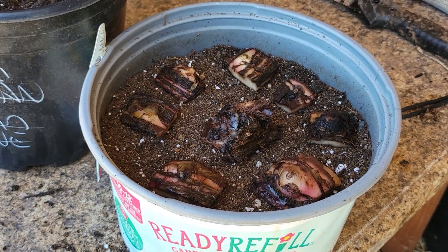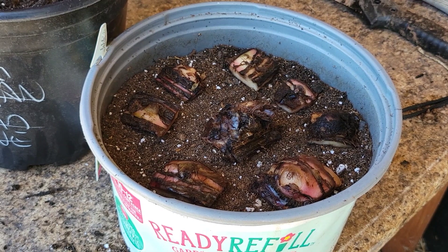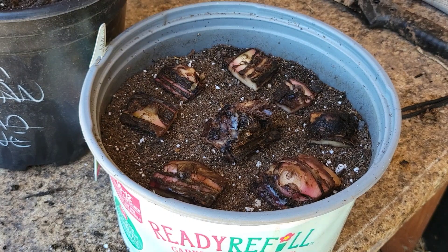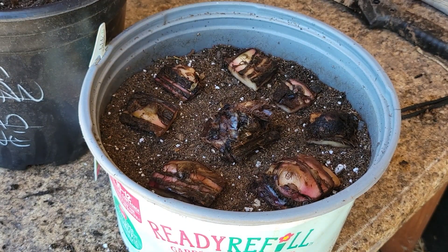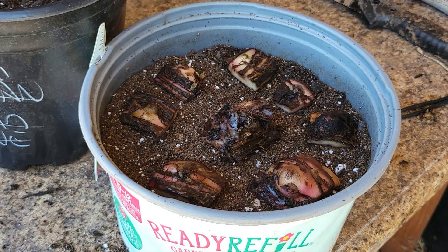If I play my cards right here, if I get 100% out of these bud tissues along with the old stock, I could possibly make nine new banana from one banana pup. So not too shabby. I'll do an update video as soon as I see some progress and let you know exactly how it turned out.